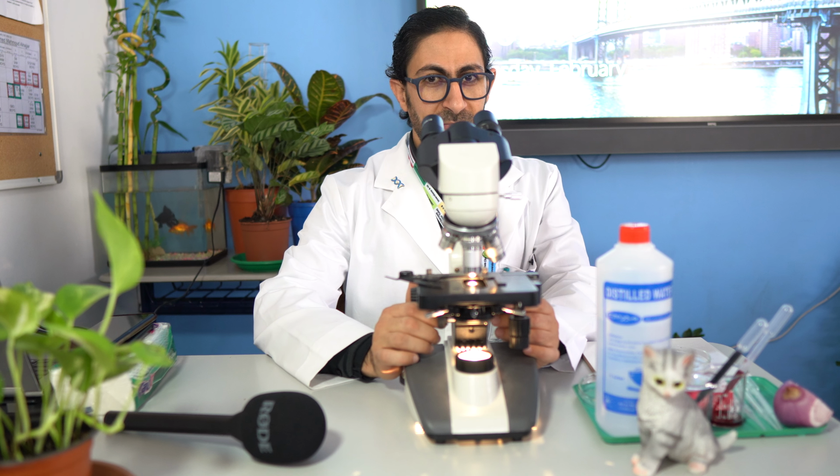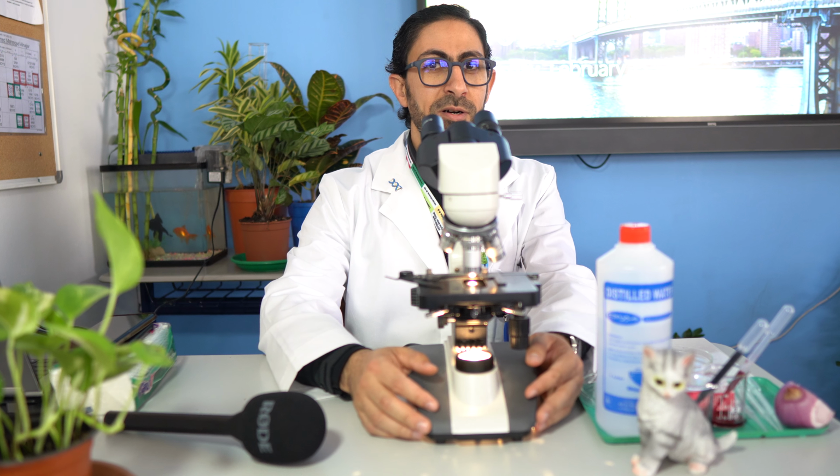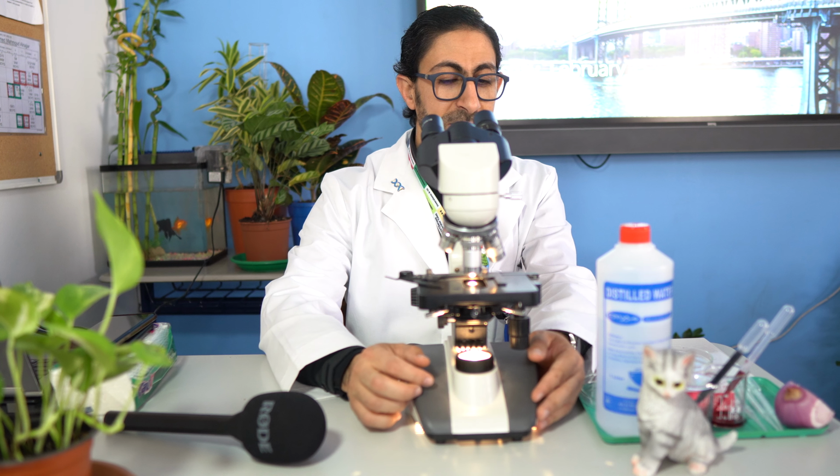Welcome, my student. Today we are providing a new activity in which we are illustrating together the structure of the compound light microscope. So let's get started.